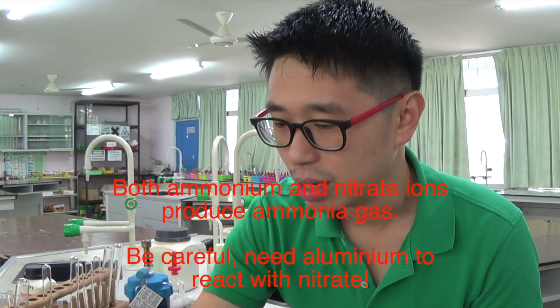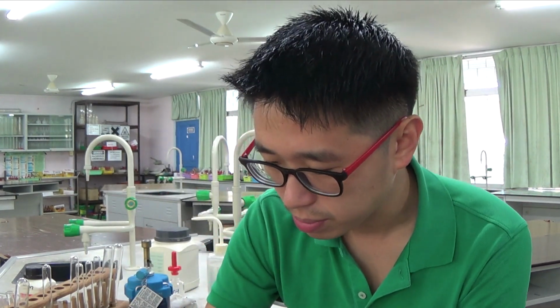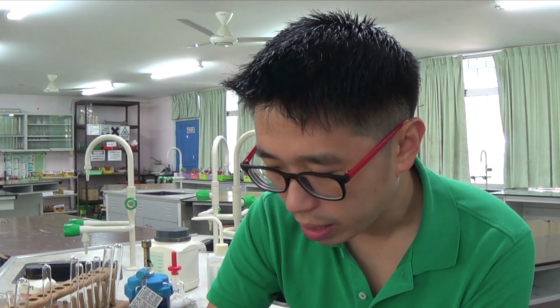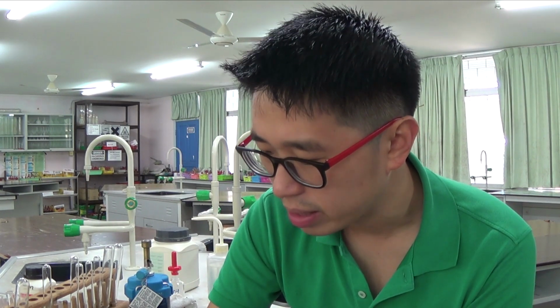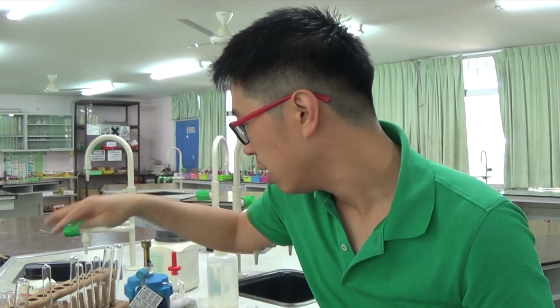So the logical thing is to identify NH4 plus first, and then NO3 minus. If you want to identify NH4 plus first, that means you don't add the aluminium foil.